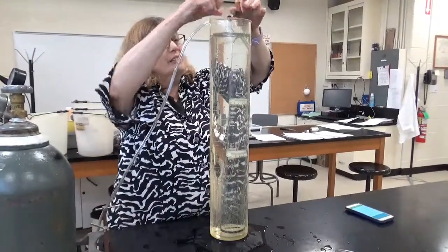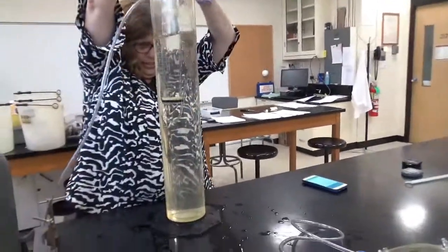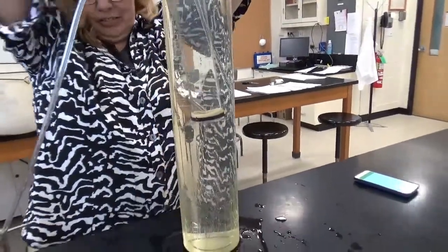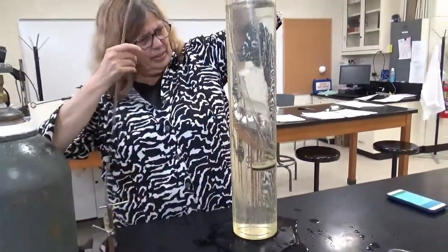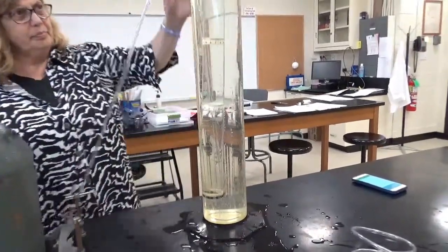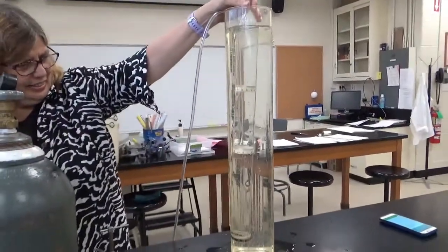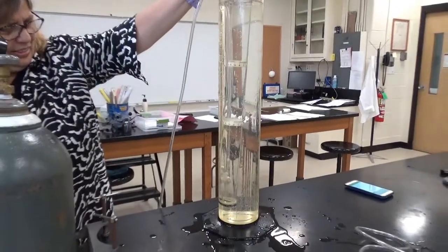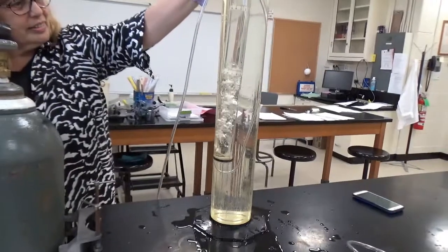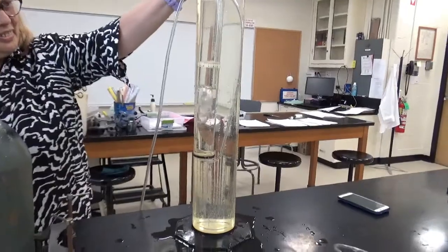All right. I'm going to do that again. But I got to get this thing on the bottom hooked in. Now, if you don't unhook that piece, it actually doesn't work very well. And you can let it sit. I don't know which way to move the valve, so I got to stand on this side. You move it in whichever way it works. All right, we're not going to put too much in there. That's a good amount. So now we've got carbon dioxide in our tube.